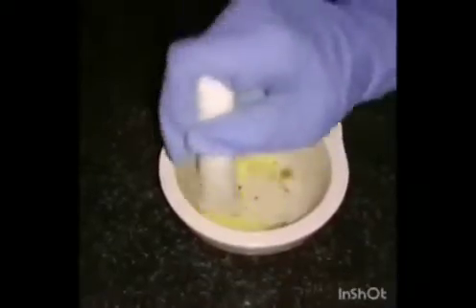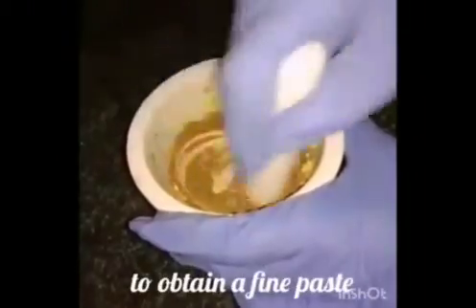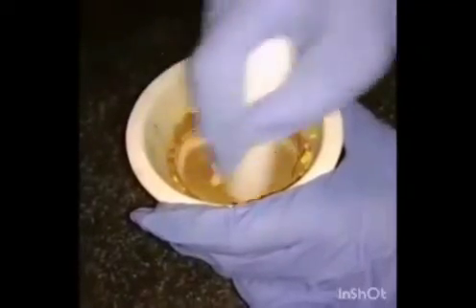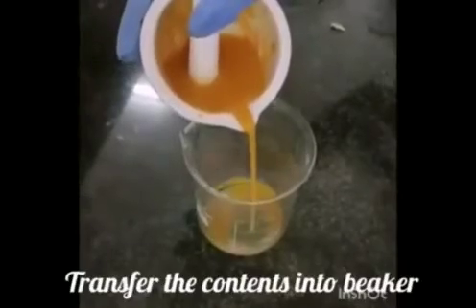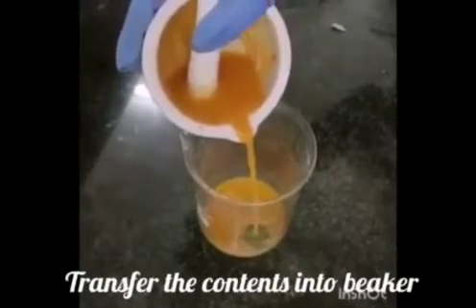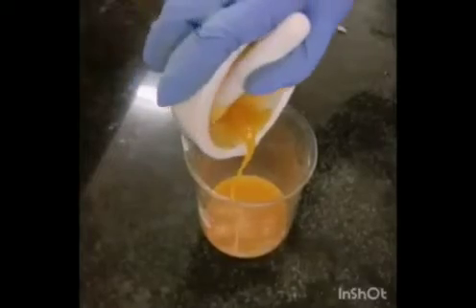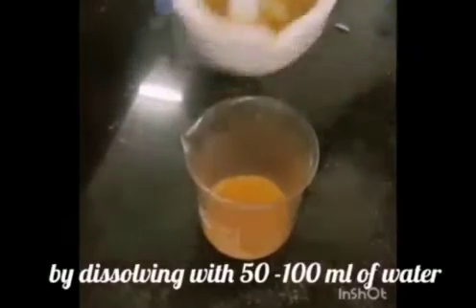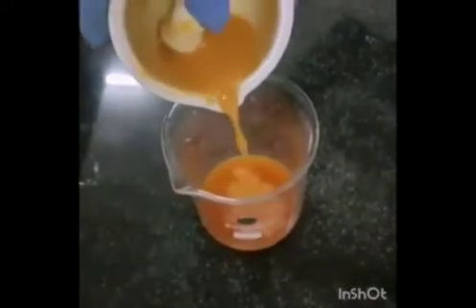...and 1 gram of urea into a china dish. Grind well for about 30 minutes to obtain a fine paste. Transfer the contents of the china dish into a beaker by dissolving with 50 to 100 ml of water.